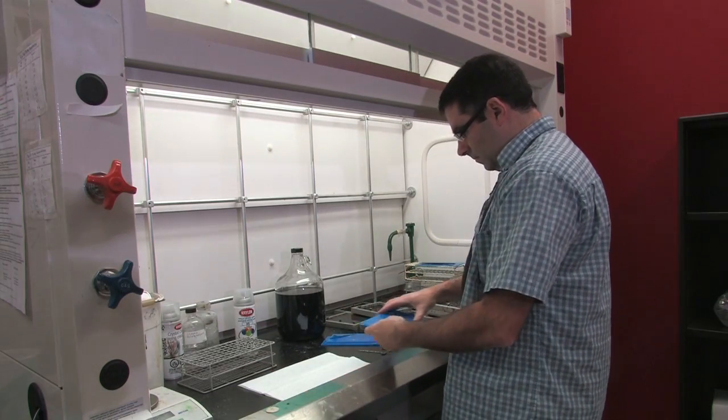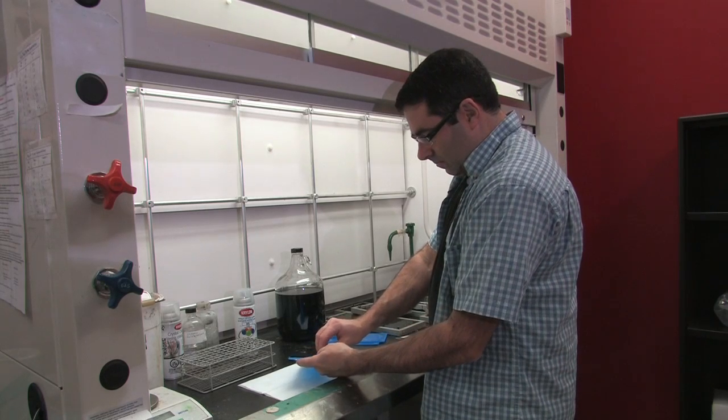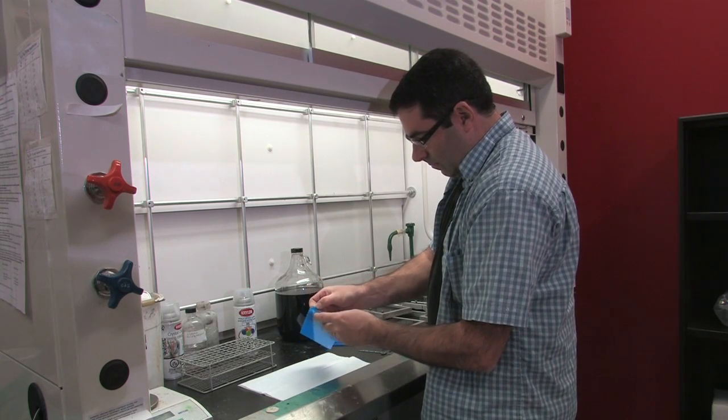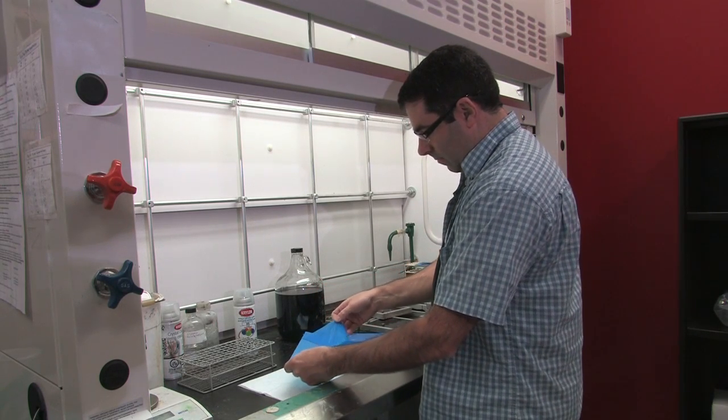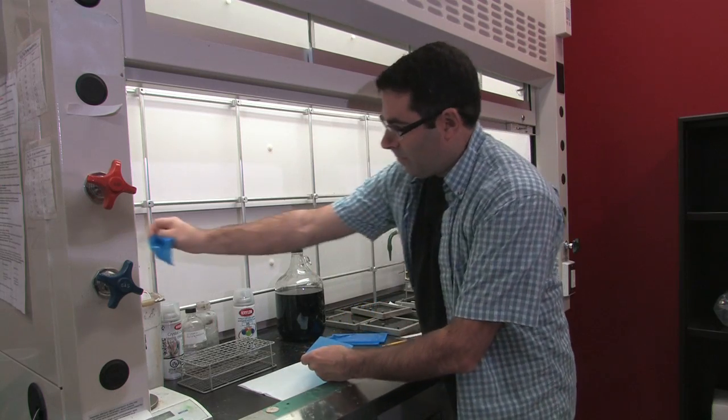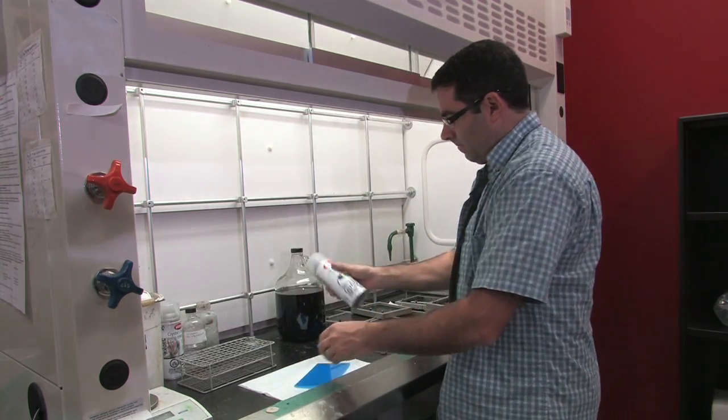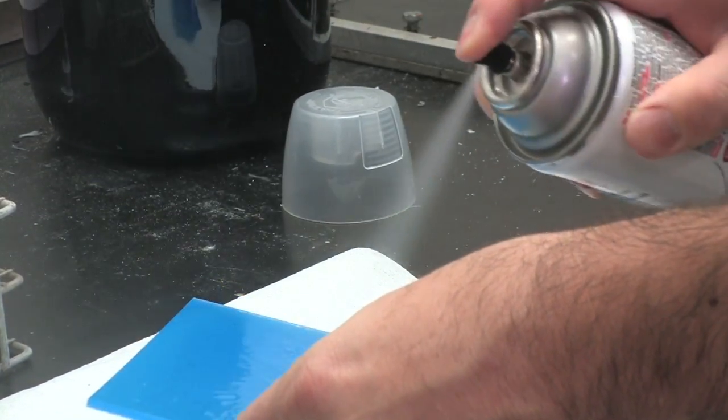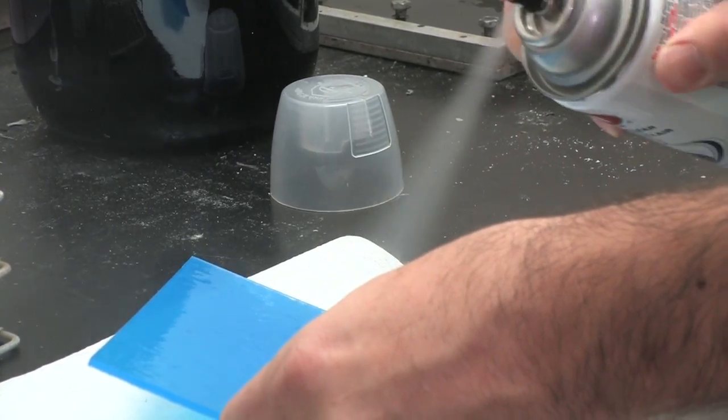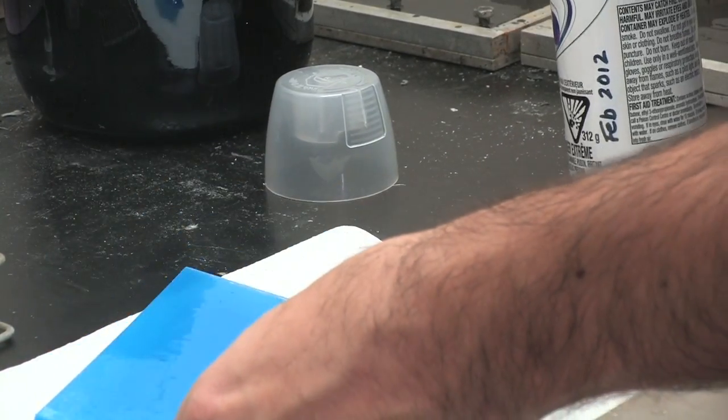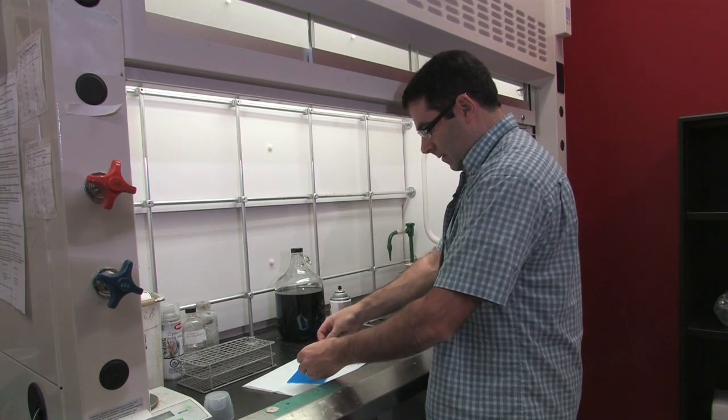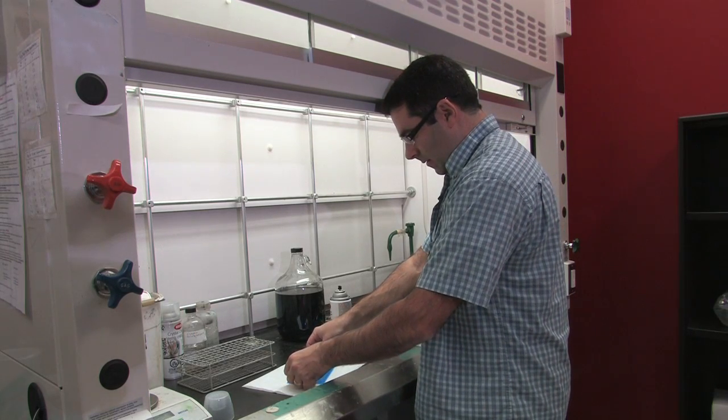To mount your sections so they are easier to read under the image analysis system, lay a piece of paper down and then take a piece of pre-cut plexiglass, remove one side of the protective film, then coat liberally with Krylon. The Krylon is an acrylic clear spray. Lay your strips down on the plexiglass and then give them another coat of Krylon.